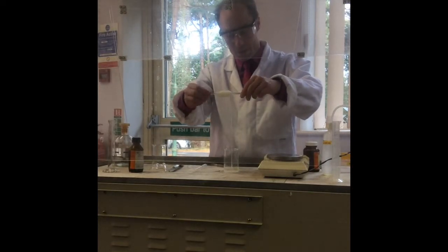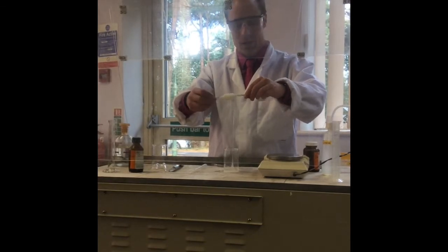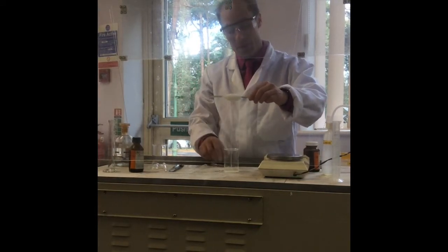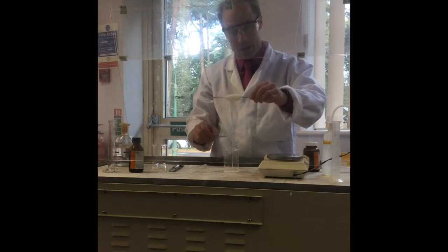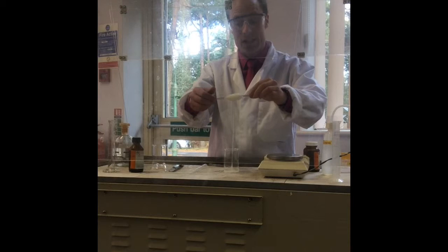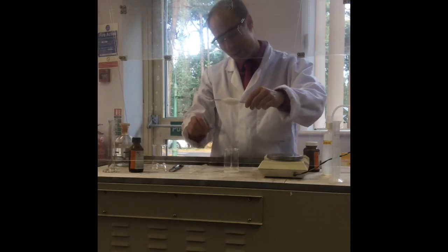When you say you could go on forever, how much is in the pot? I could go on for quite a long time. It has gone down a lot in the cup. So you're using up the liquid? Yeah, a little bit. You can see the liquid. Keep going. Is anything else produced? Only HCl. HCl's being produced. Keep going.